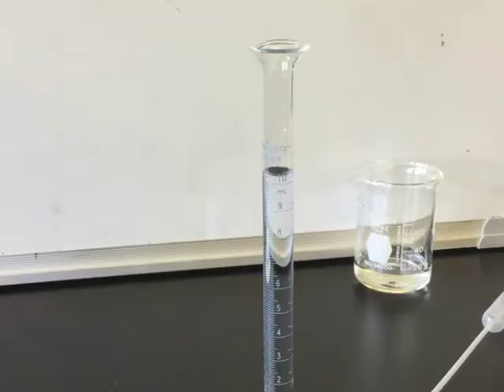In order to find density, we need to have the volume. Your lab manual doesn't provide a spot for this. You can find the volume in one of two ways. One way is to make sure that you're at exactly 10 milliliters, and the other is to make sure that you record precisely what the graduated cylinder says. You will notice that this graduated cylinder has more than 10 milliliters of liquid in it, so I can use a pipette to adjust the volume to the appropriate level before I write down my 10.00 milliliters.